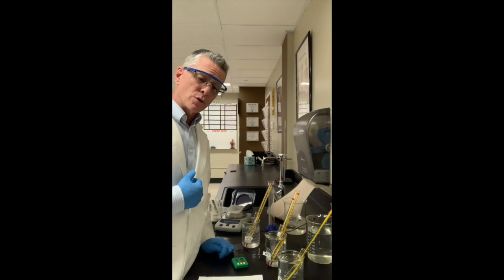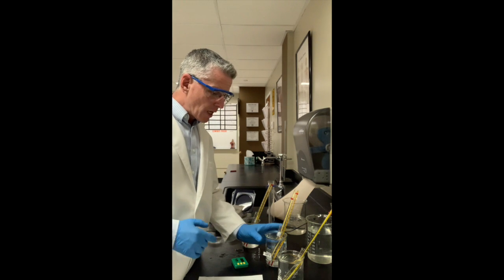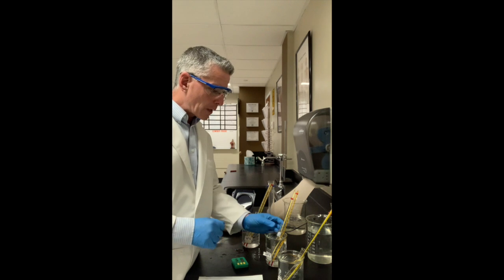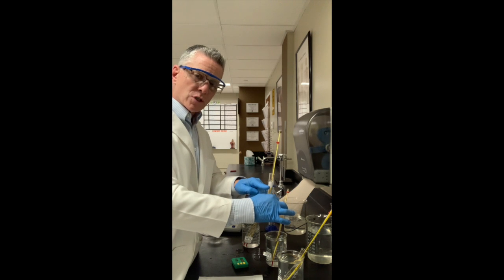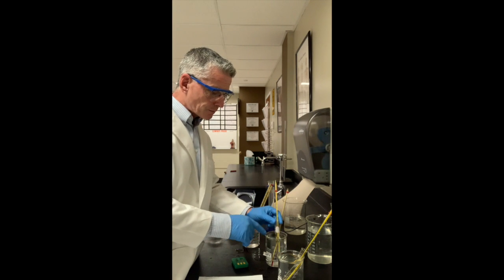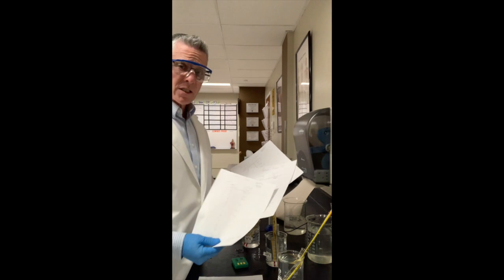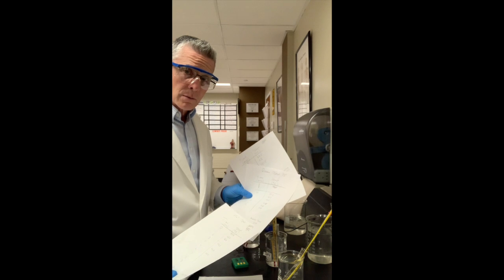I thought that this was going too quickly, and I've redone the lab. I had originally done the lab with Ms. Johnson, and we used beakers that were smaller in volume, and I was concerned that we were losing too much of the temperature from our faux anus since it was only halfway submerged. I thought that maybe the top portion was giving off heat to the environment at a rapider rate than would have happened in the solution. But if you take a look at the data that we got when Ms. Johnson and I did it together here, the changes almost match precisely.